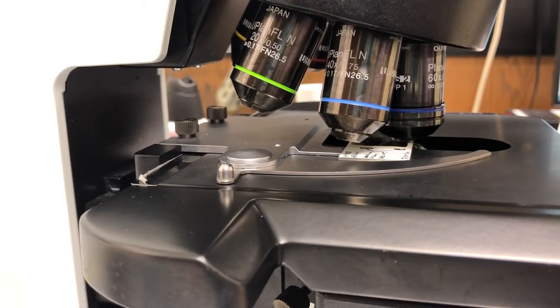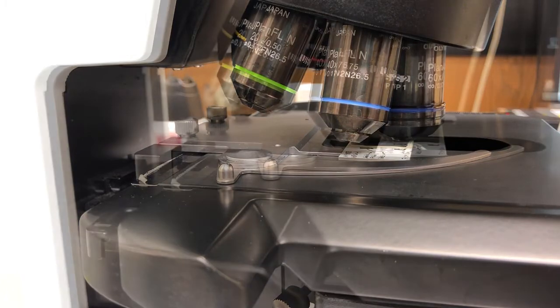So I'm going to take a look at the sample and then I'll show you how to clean up and remove the sample safely.